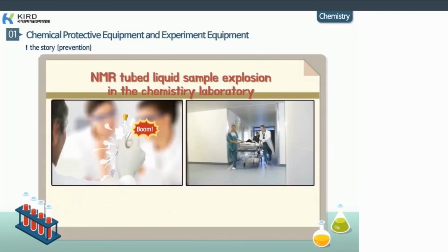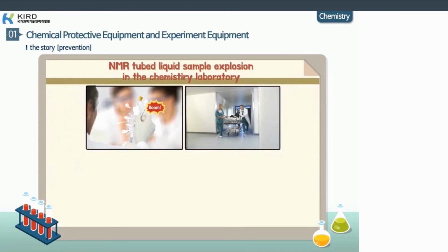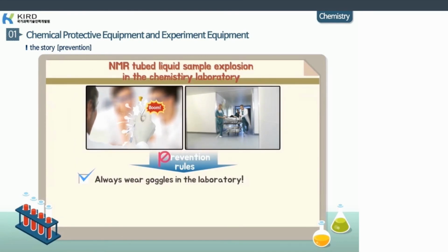Okay then, should we take a look at possible ways to prevent the laboratory safety accident in the story Danger, on account of what we have learned so far? First, goggles should always be worn in the laboratory in case of an unexpected emergency. Even in this accident case, if the professor had worn goggles, the accident would not have been this big.